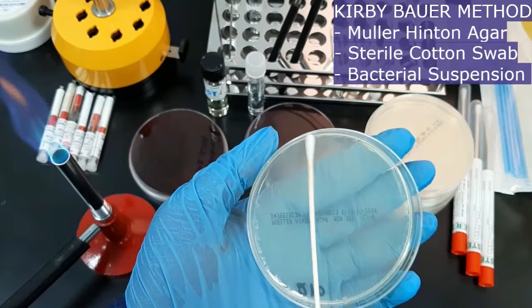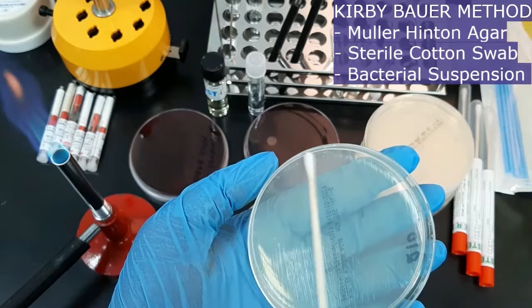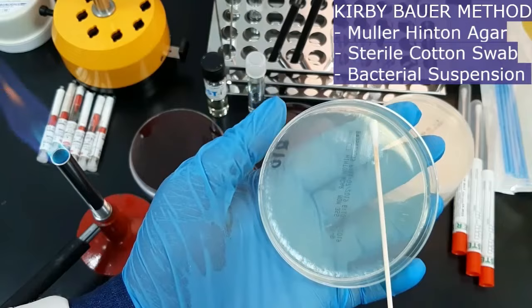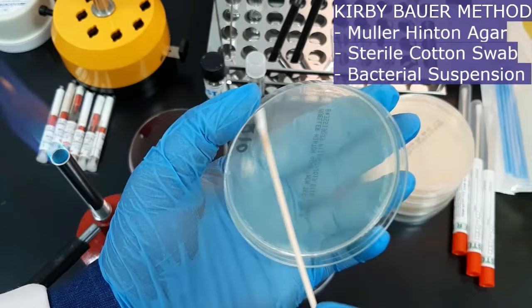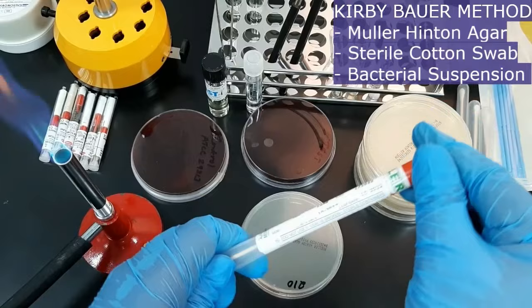After completely swabbing the plate in one direction, slightly rotate the plate and continue swabbing. Repeat the swabbing process, and finally run the swab around the circumference of the plate. Close the plate and dispose of the swab in a biohazard container.